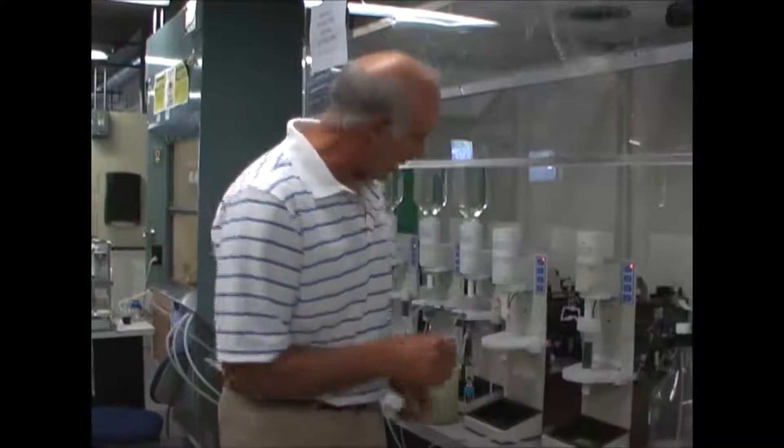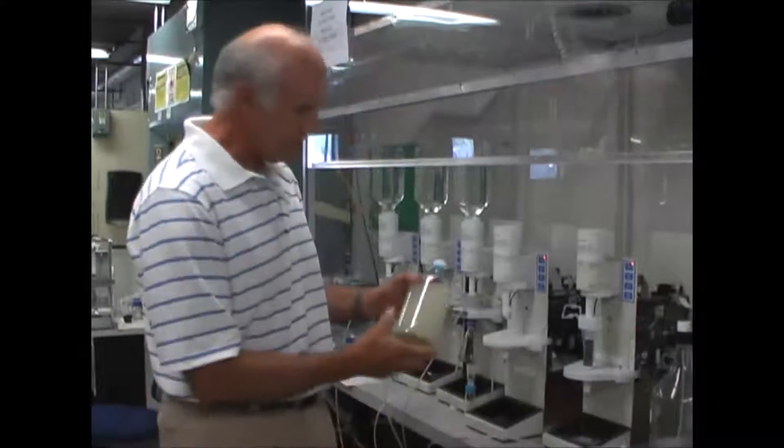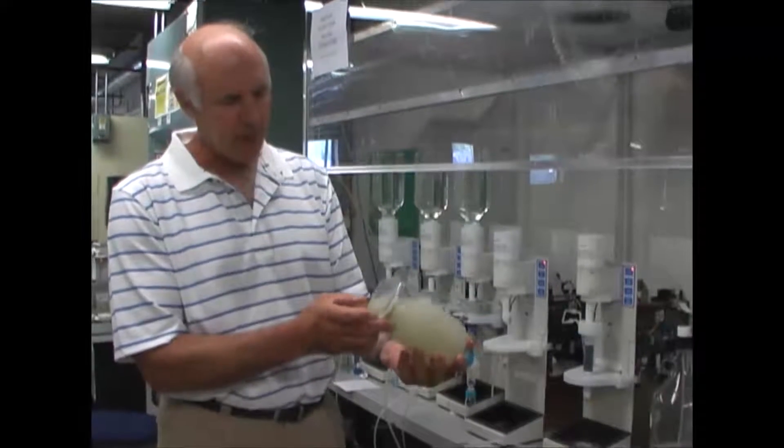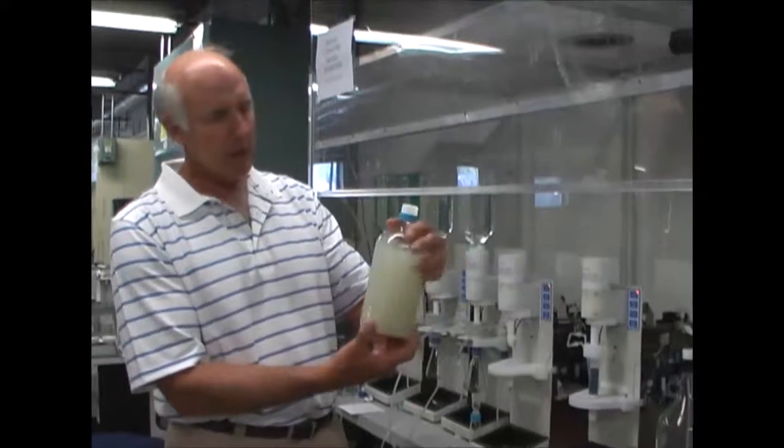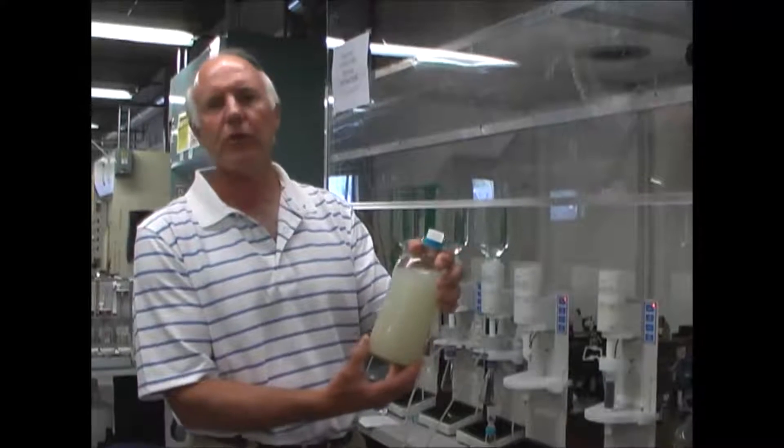The sample that I'm actually going to run today is here. This is five grams of bentonite clay, which gives a range of around two to five microns.